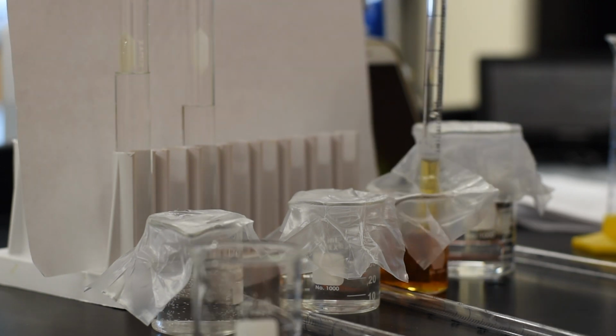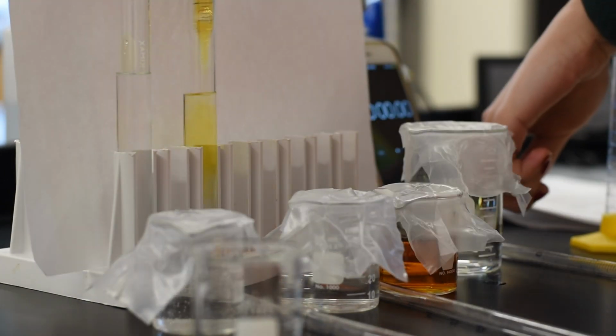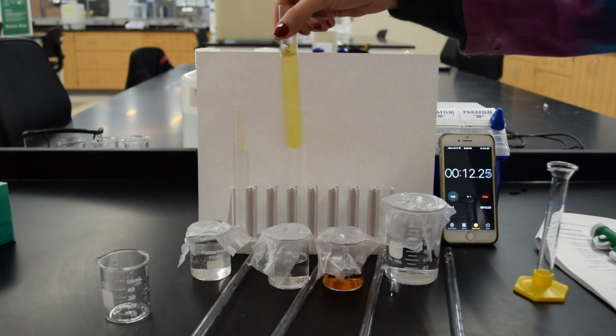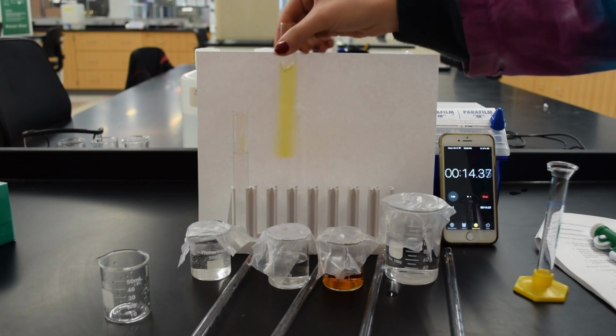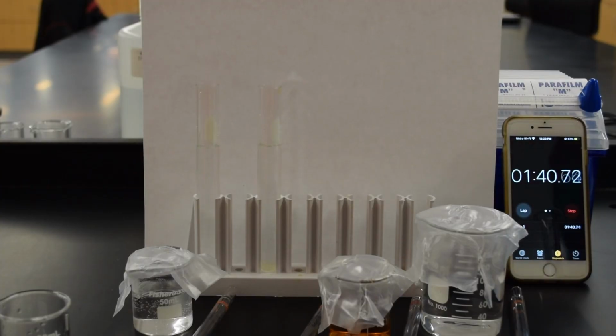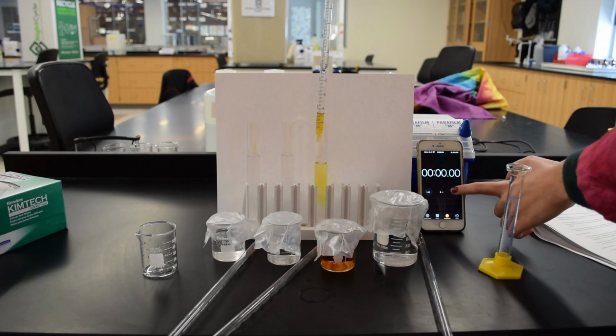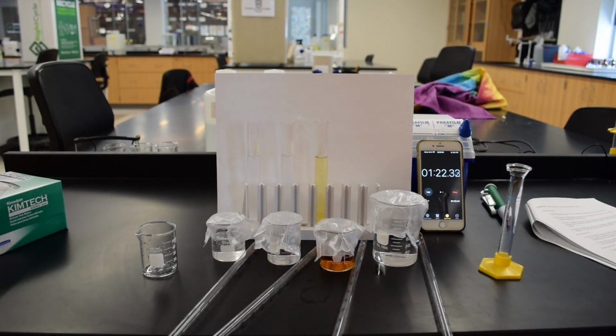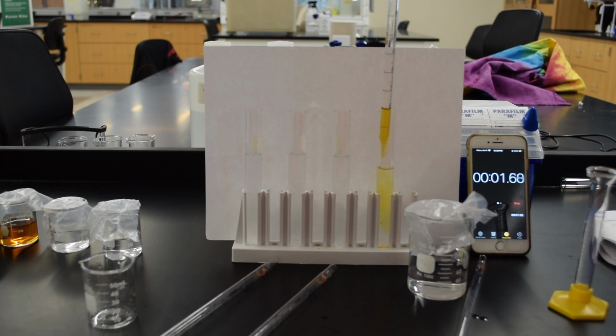So again, mix everything together, add that iodine, be ready to hit it. As soon as that iodine touches, start your clock and be ready to record exactly how long it takes to do it. Now, every batch that I make is different, so you have to be ready to record exactly how long it took. So now you need to do it one more time and just verify that it's within 10% of the amount. If it's not, you have to do it again.